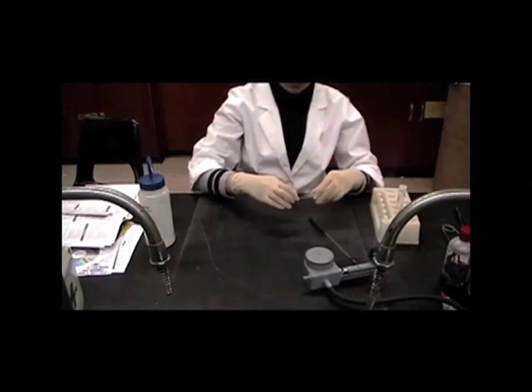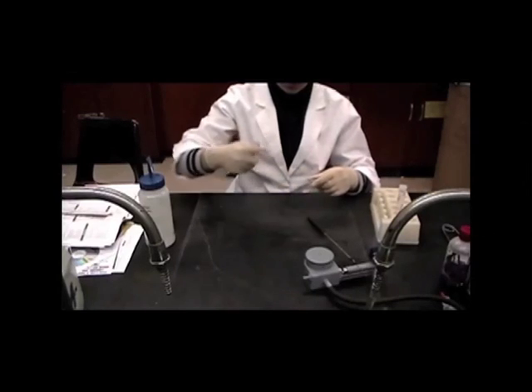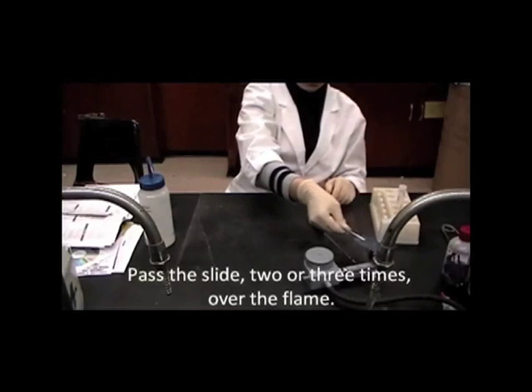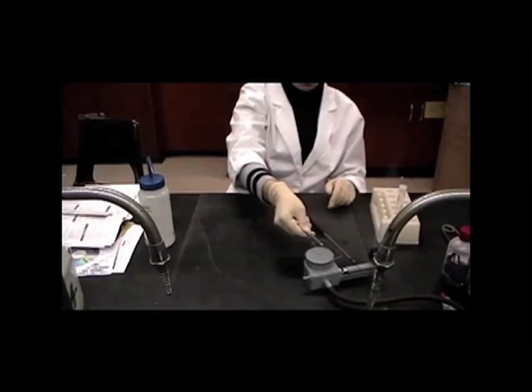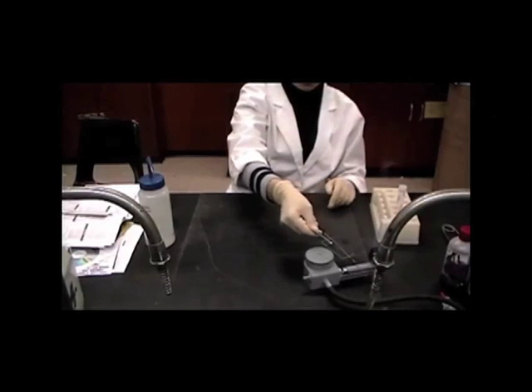And then with a forceps, the slide with the bacteria is passed 2 or 3 times over the flame. Then one waits until evaporation starts. Again, 2 or 3 times.